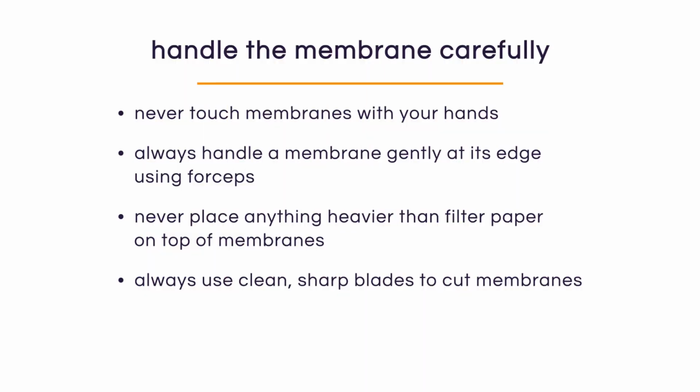Did you know that if you use a blunt object to cut your membrane, instead of having a clean edge, you may end up having a membrane that's peeling? Now, that may not be obvious to the naked eye at first, but as the membrane goes through the different steps of the protocols, those fragments are going to start to peel, and they may end up binding to the surface of the membrane, creating unwanted background. Not only that, but the peeling edges are also susceptible to different molecules binding to them and creating unwanted background as well. To prevent that, make sure to always use clean, sharp blades to cut your membranes.